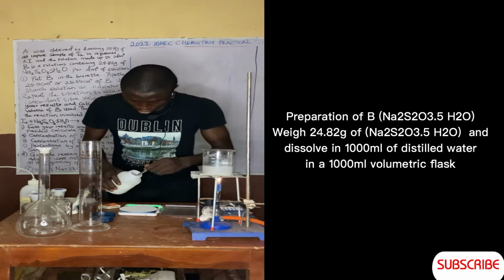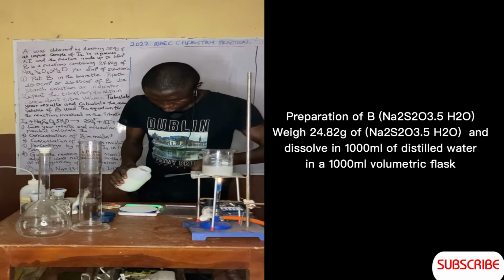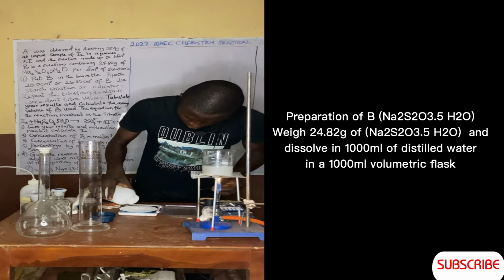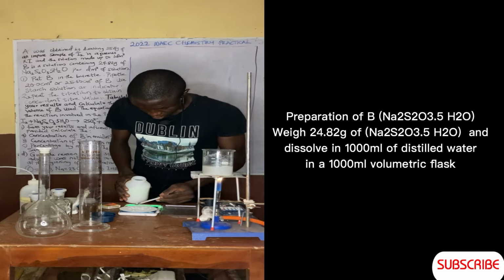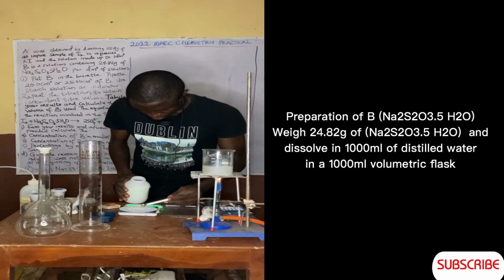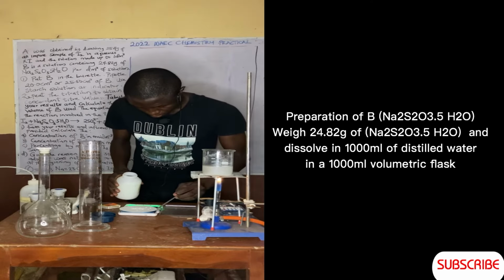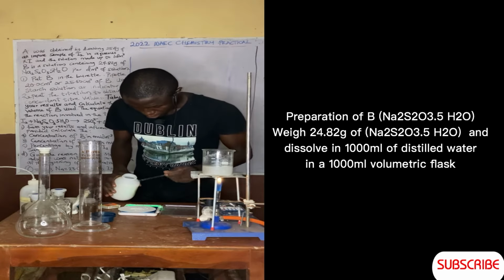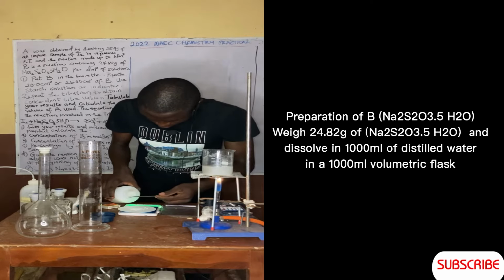So now let's measure 24 grams of this. I'm going to need a lot of it, and make sure that this thing does not pour down. Make sure there's nothing on the scale itself.